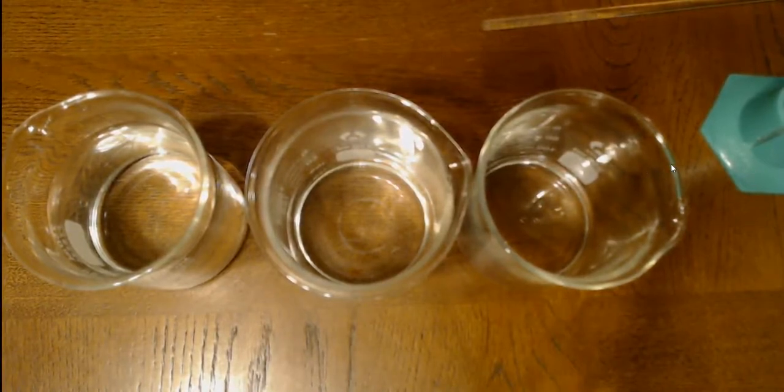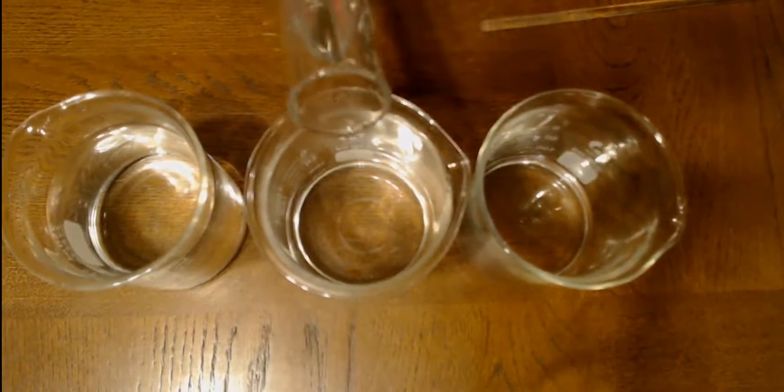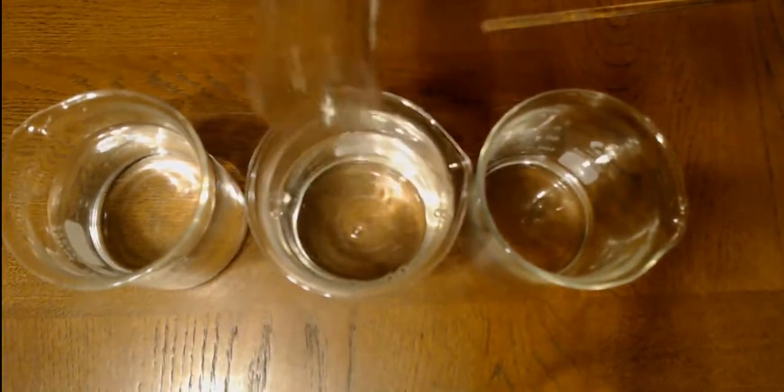Now we're going to vary the concentrations. What I'm going to do is add 100 milliliters to the center beaker, thus bringing its total volume up to 200 milliliters, which equals the 200 milliliters in the other beaker, but only half of that is vinegar. The rest is water. So if half of it is vinegar, it's got half the concentration of the first beaker. So I'll add 100 milliliters here to bring that up to 200. And it'll kind of mix itself there, so not a big deal.